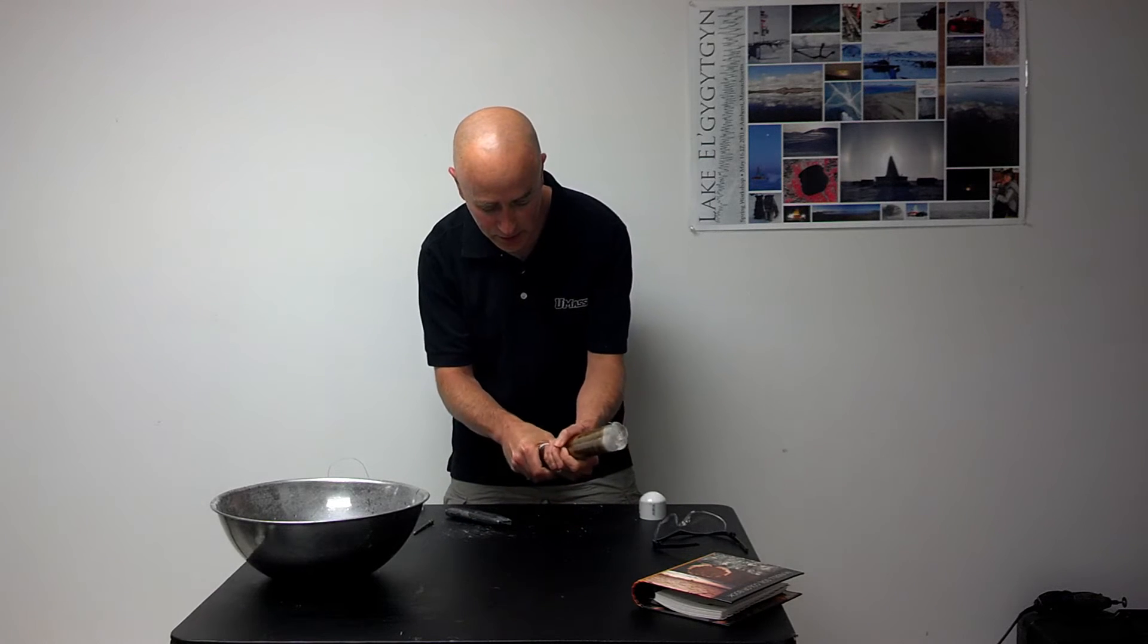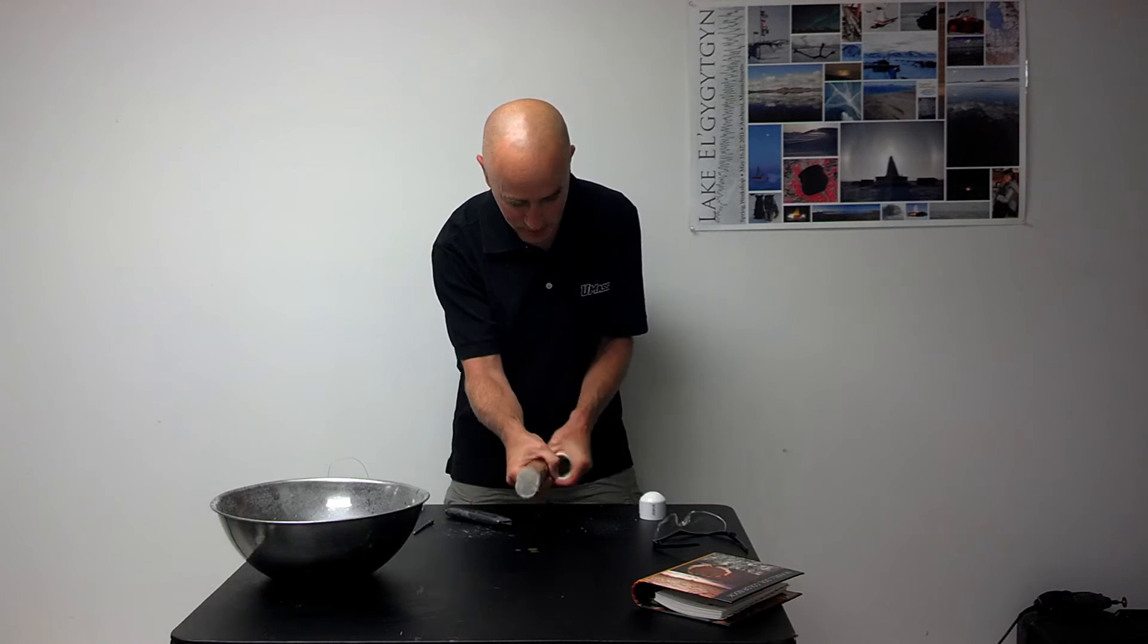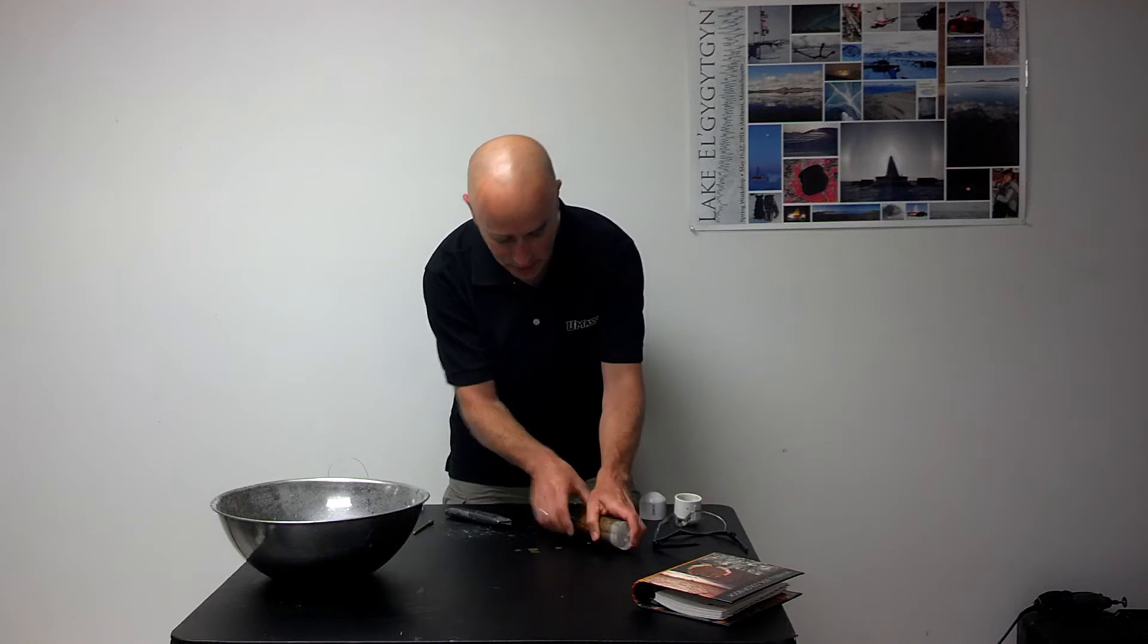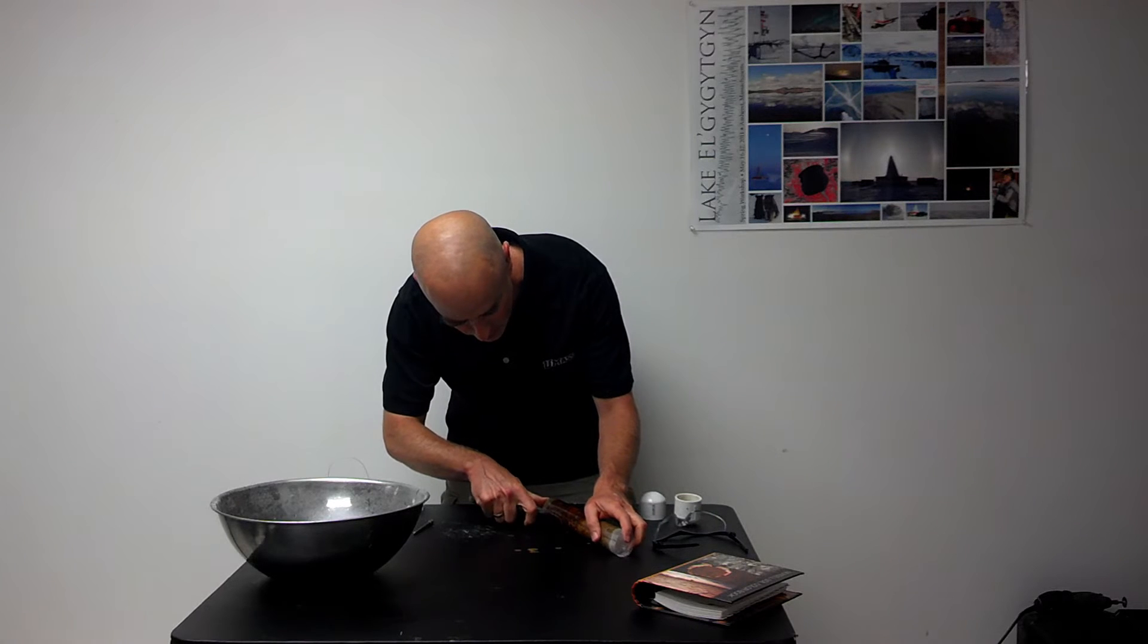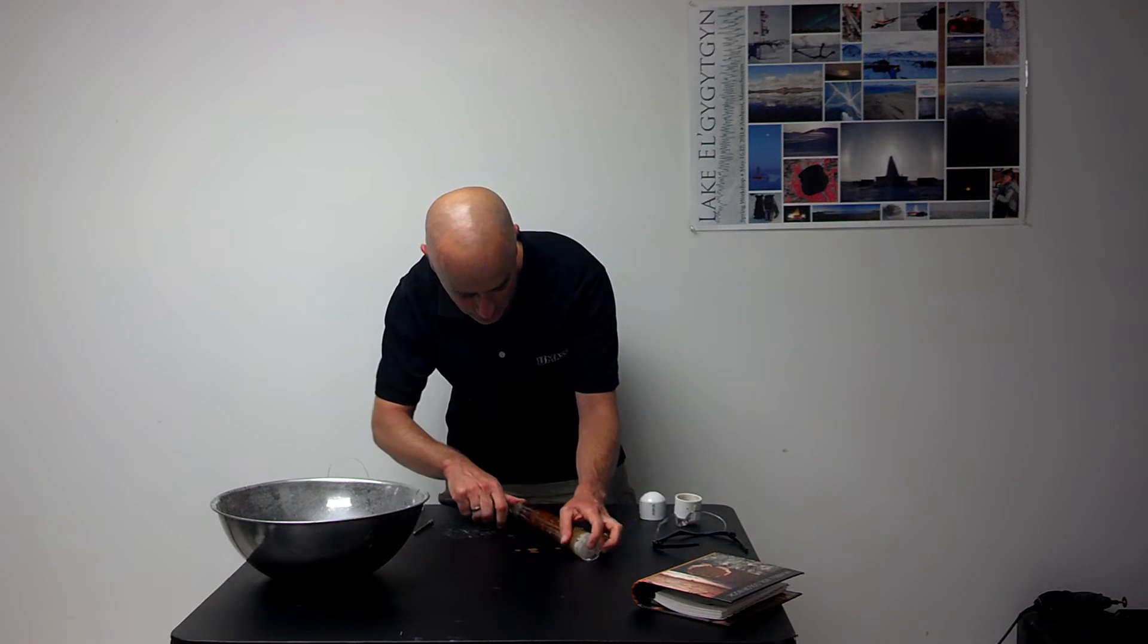At some point, I'll need to remove the core sample from the bottom cap. Now I'll finish cutting the remainder of the plastic on both sides.